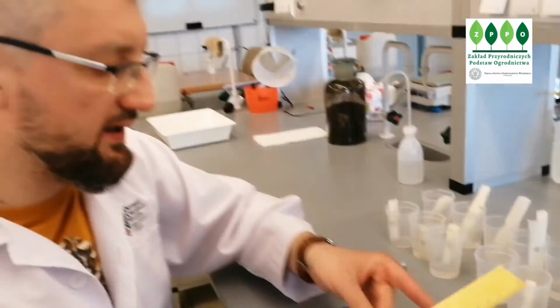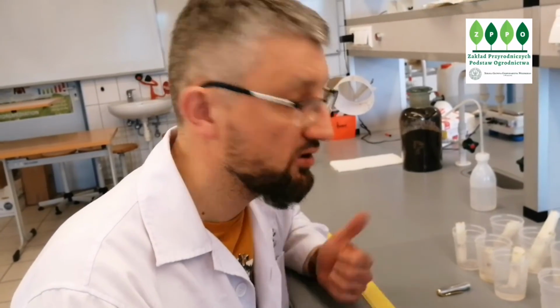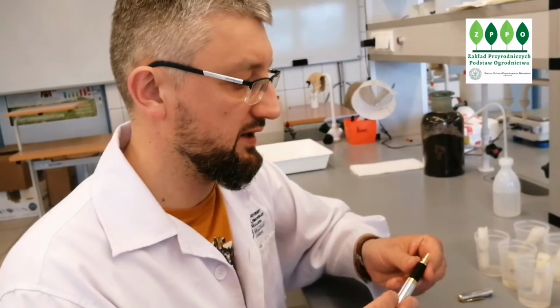And then you will get all those values for each treatment, salt, and 2 different allelochemicals, controls for each. For control, you can do an average from all the control beakers. You will get all the data tabulated. You will have to, once again, do the averages and calculate the tolerance index.